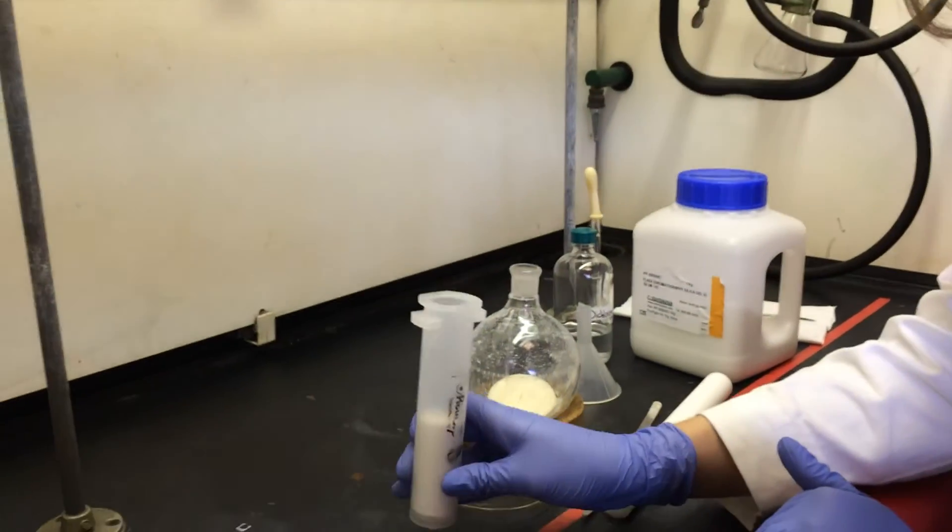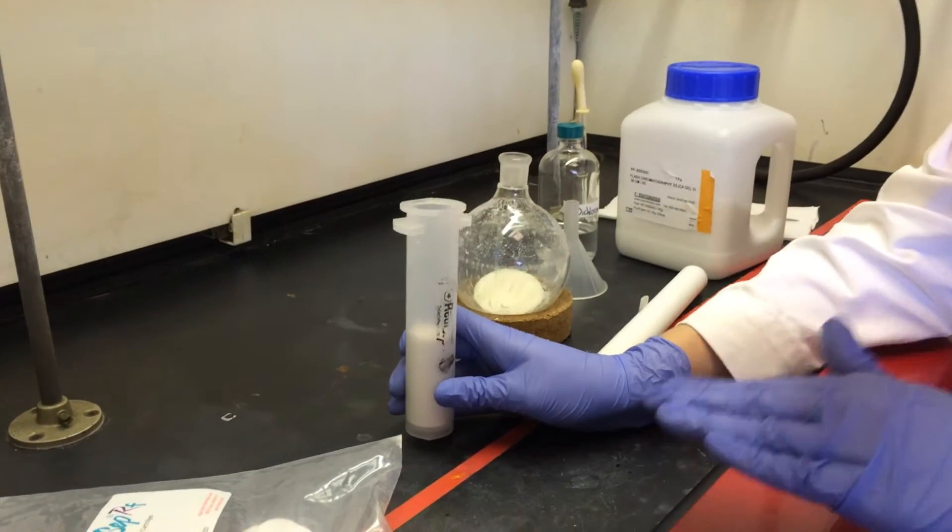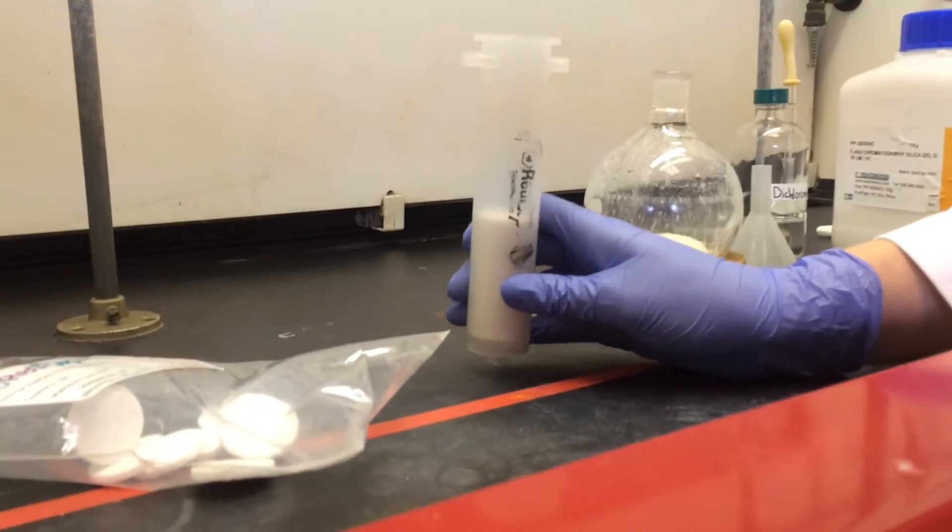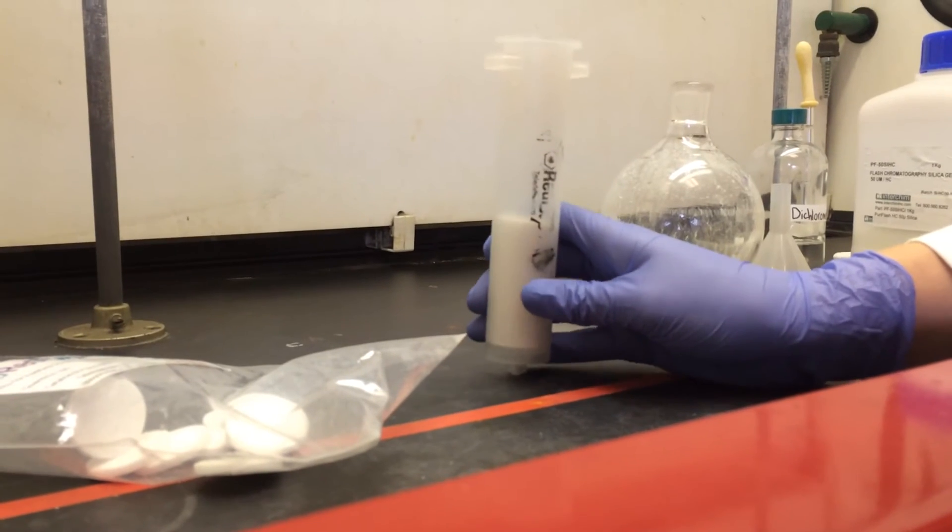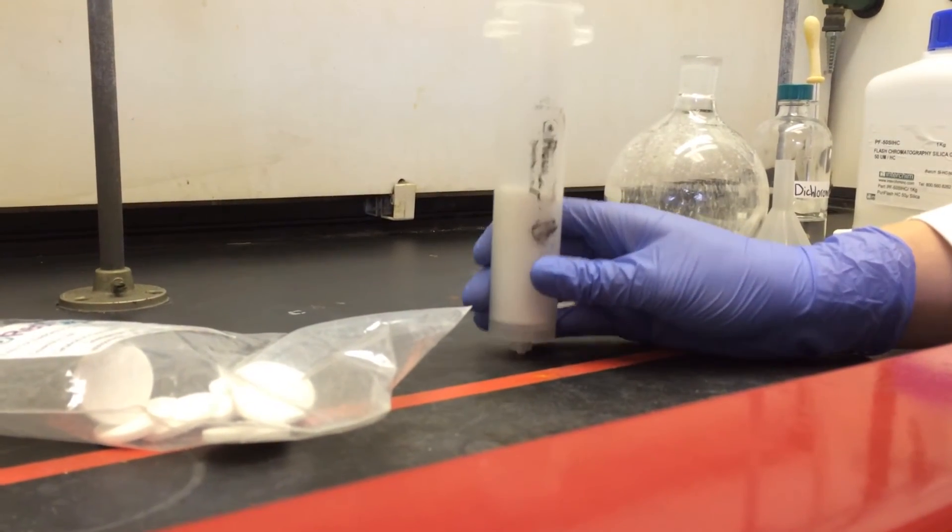You want to tap this a few times and make sure that it's level. If it's crooked when you load your sample, then the combi won't work properly.